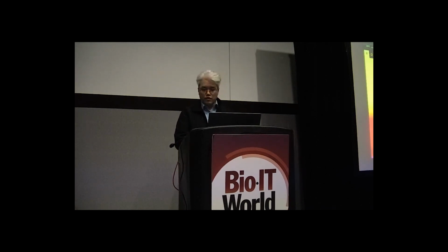Before I forget, make sure that the region you're operating in is US East 1, which is closest to here. That's in Virginia, and that's where all the workshop stuff runs.